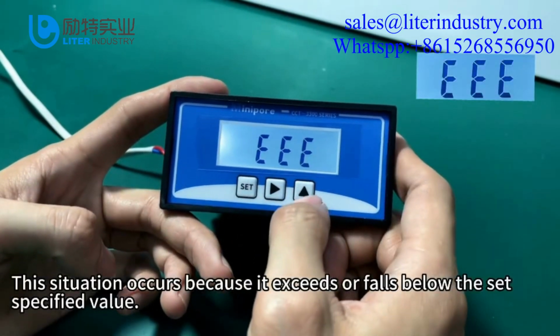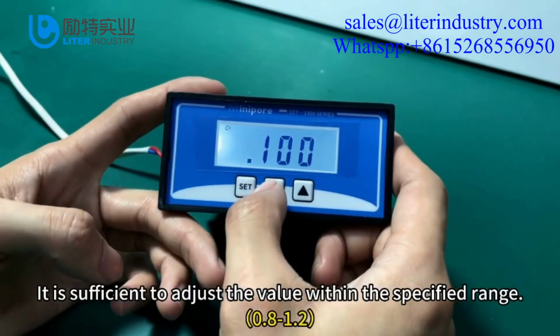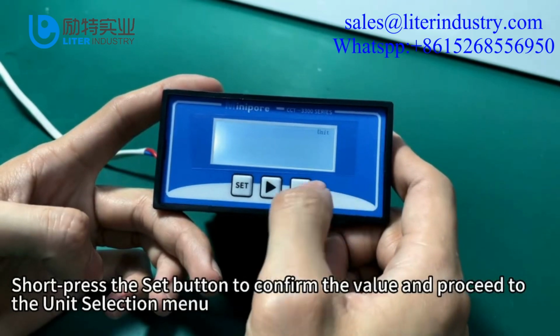This situation occurs because the value exceeds or falls below the specified range. It is sufficient to adjust the value within the specified range. Short press the set button to confirm the value and proceed to the unit selection menu.